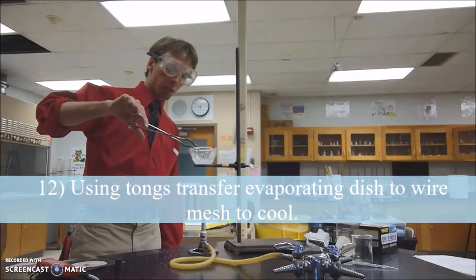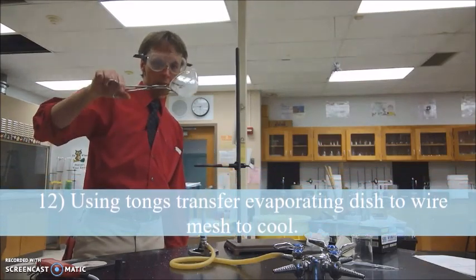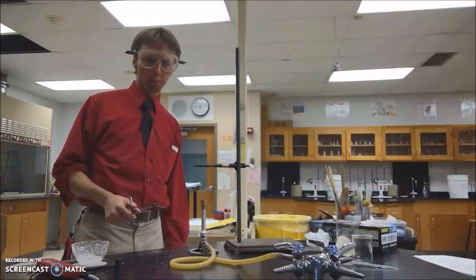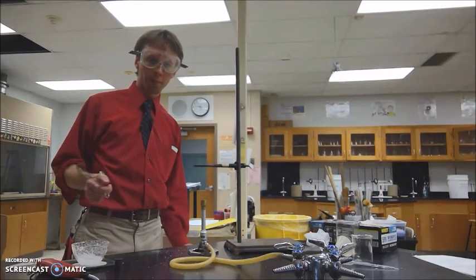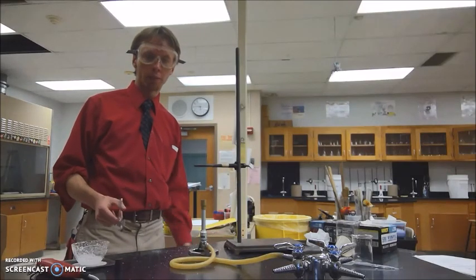You're going to carefully transfer it from the heating station using a set of tongs onto a wire mesh until it cools. After that, leave aside all the hot materials to cool down and perform your cleanup. There's no post-lab or any other activities you have to do afterwards. This is the end of the video for the second quarter lab, separation techniques.